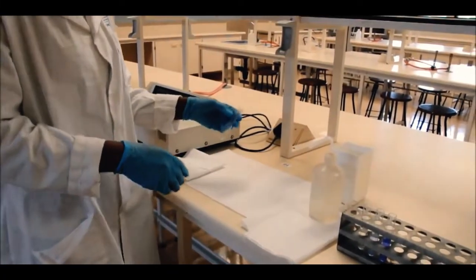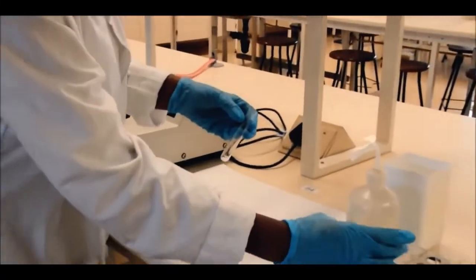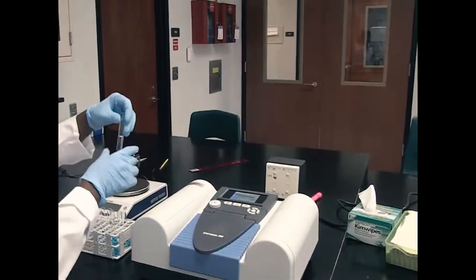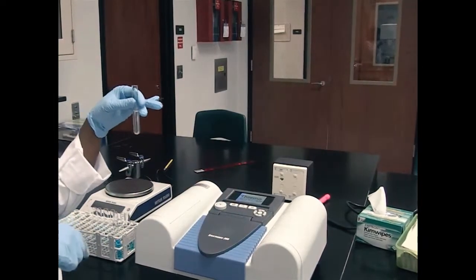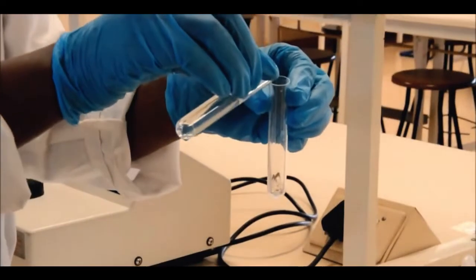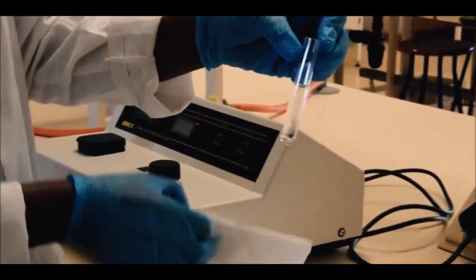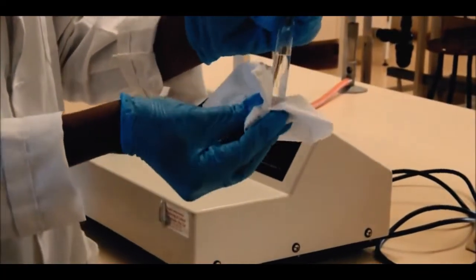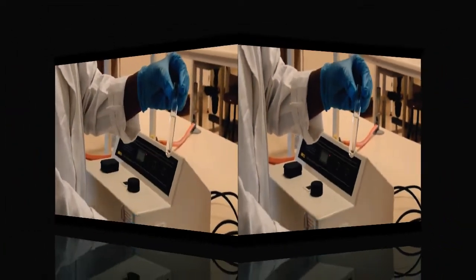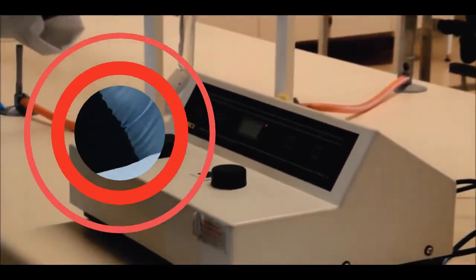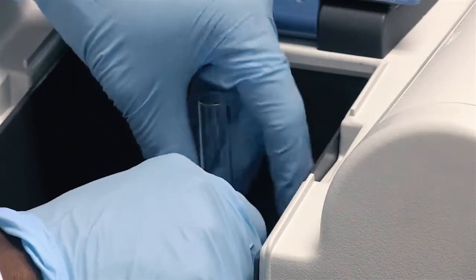You will use a dedicated cuvette. Always start by rinsing the cuvette with distilled water. The first solution to use is a blank solution. This is carefully transferred to the cuvette, where after the cuvette is carefully wiped with a paper towel to remove any liquid and to ensure that it is clean before inserting the cuvette into the spectrophotometer.